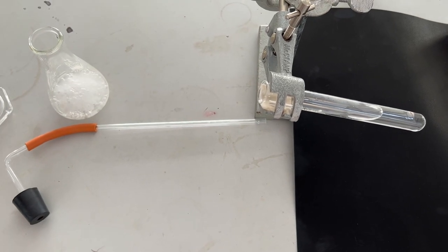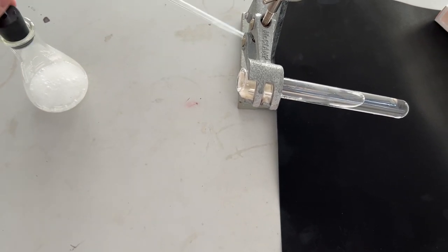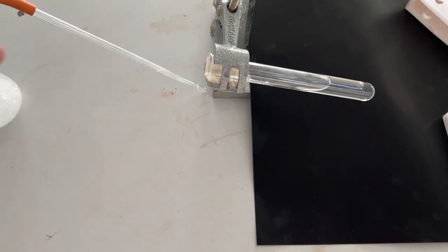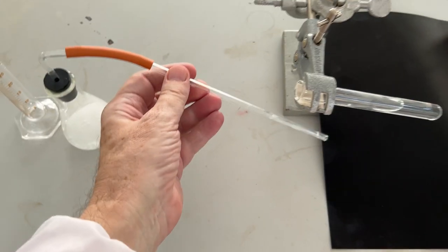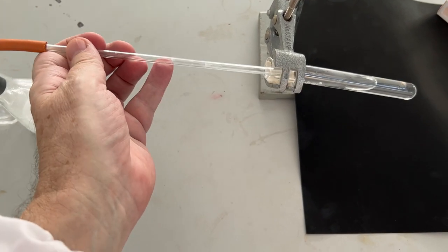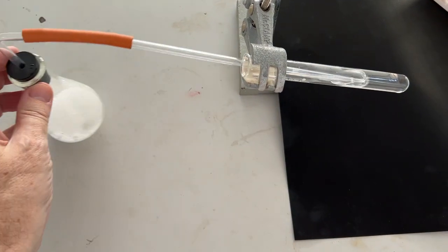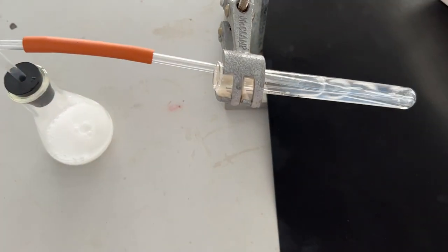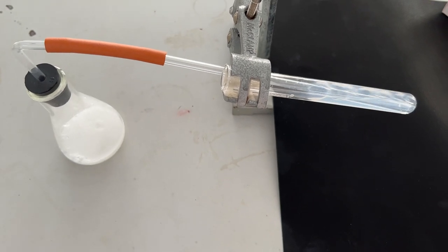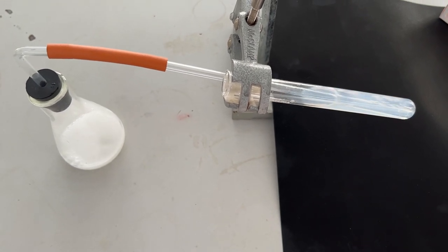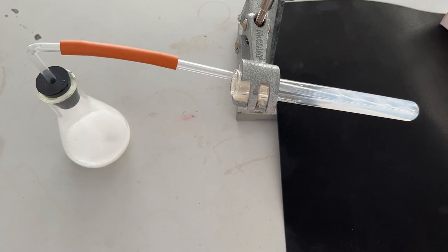Insert the delivery tube, and now we can place the tube into the lime water. Very quickly, the lime water goes cloudy or milky.